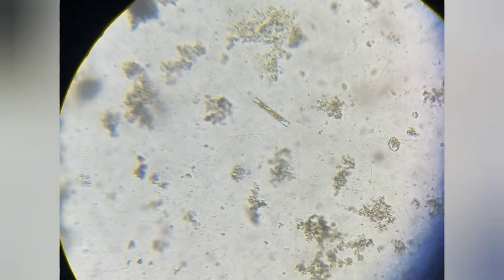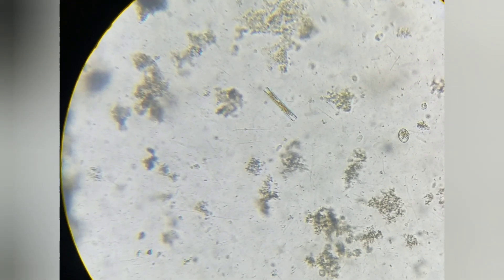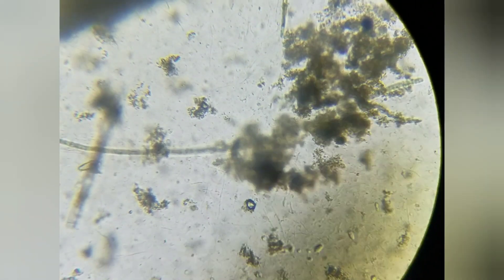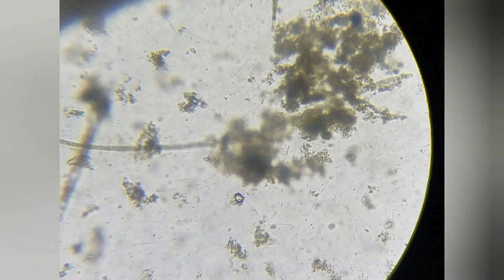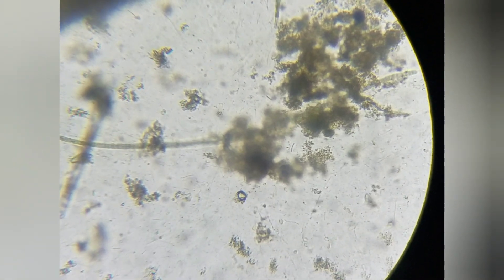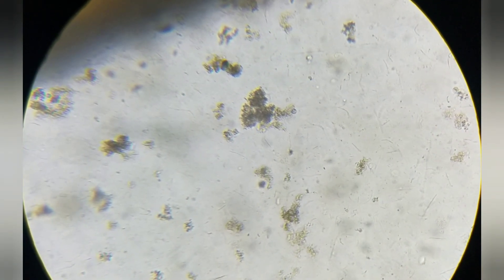I was actually really surprised at what I saw. What you can see here is lots of microorganisms going around, but they're not what I expected. I expected this to breed paramecia, but it seems like there's only one or two paramecia flying around. It seems to have bred these other little ciliates instead. I guess you have to find out what's in the population in order to do this — if there are more ciliates, it's probably going to be the ciliates that multiply, like what happened here. There are just mass amounts of these ciliates, and they're just everywhere.